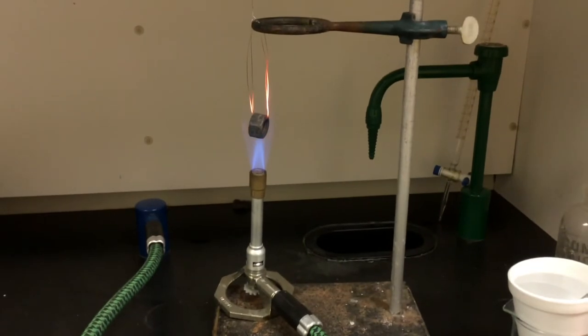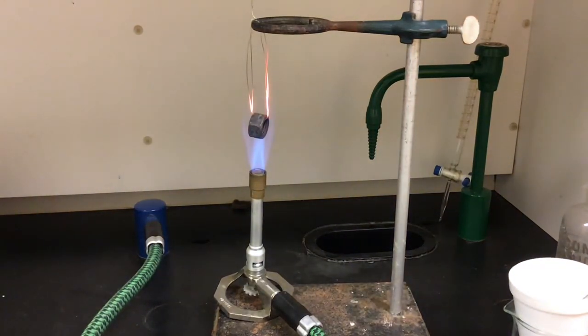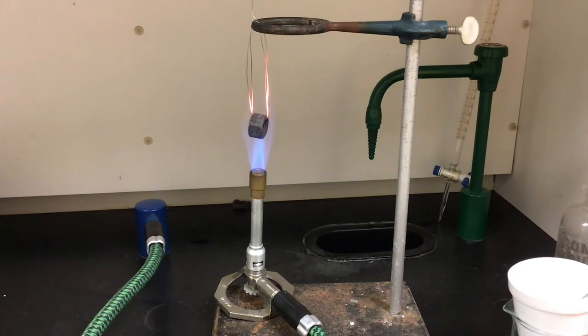You can see right away I dim the lights. You can see that nichrome wire start picking up that heat really quick and it's going to take a while. We're going to cook this thing. We're going to speed the video up and we'll come back to it.